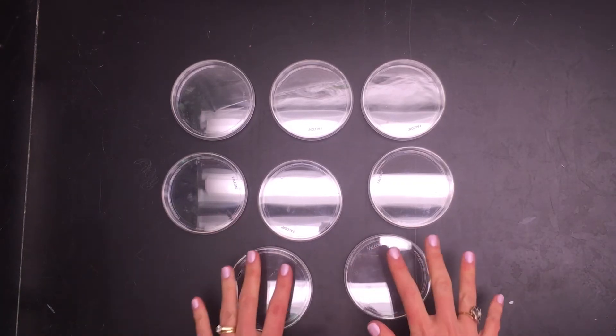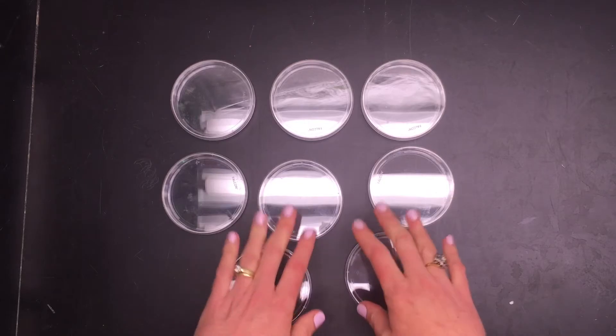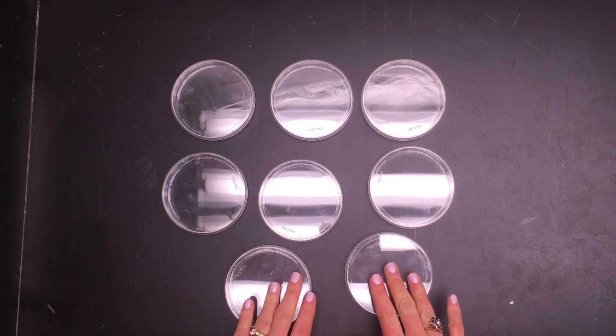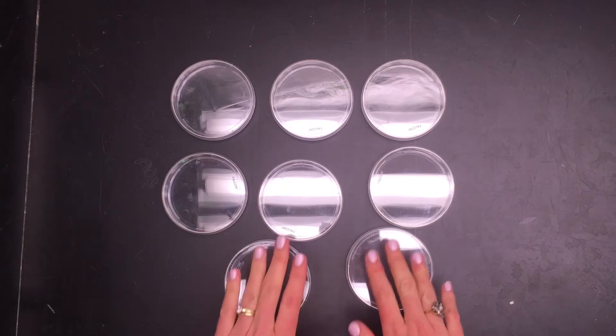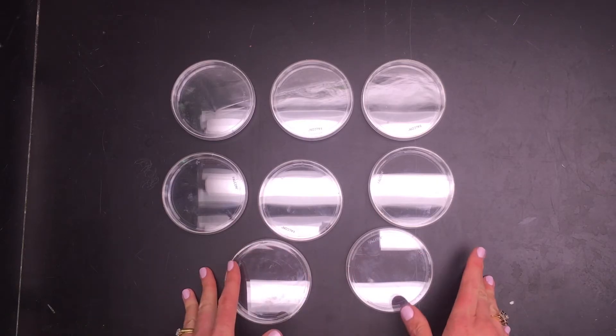I'm going to teach you today how to set up your petri dishes for the air particulates lab. After you have decided the question and hypothesis and your experiment's design, it's time to go ahead and make your petri dishes.